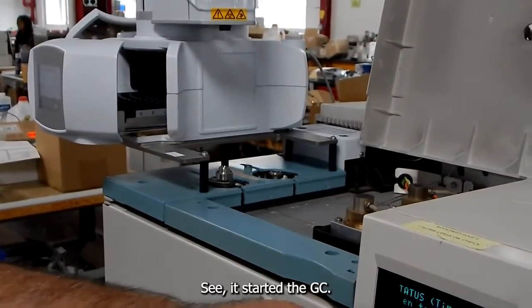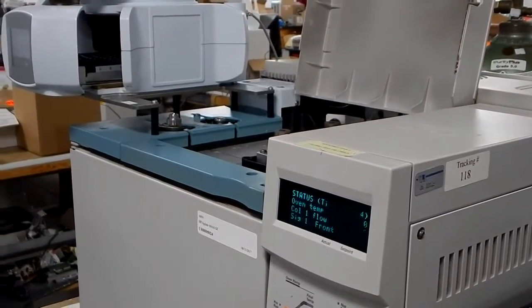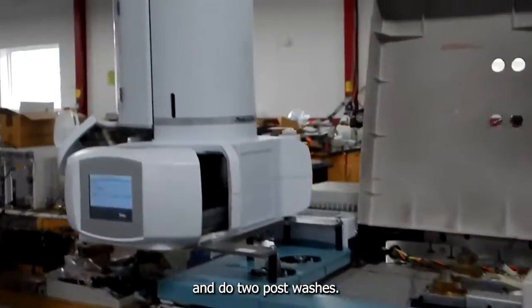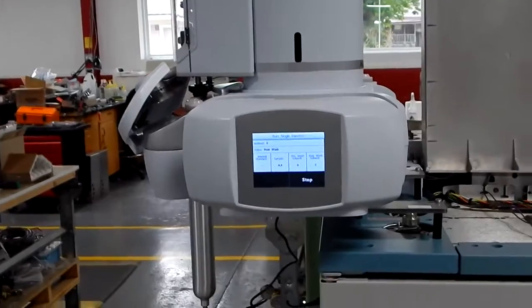See, it started the GC. On the autosampler, we're going back and doing 2 post washes. This time in vial C because we chose that.